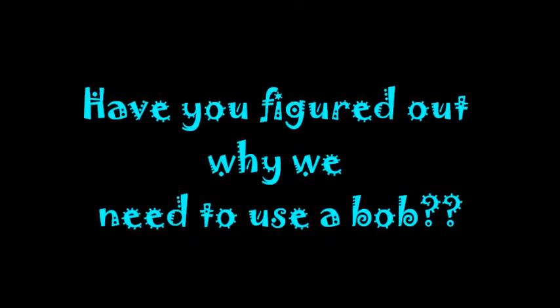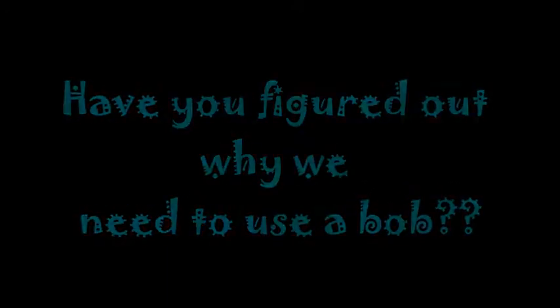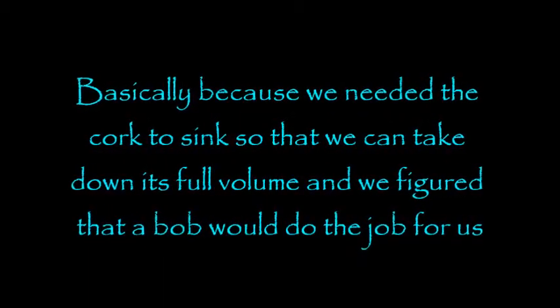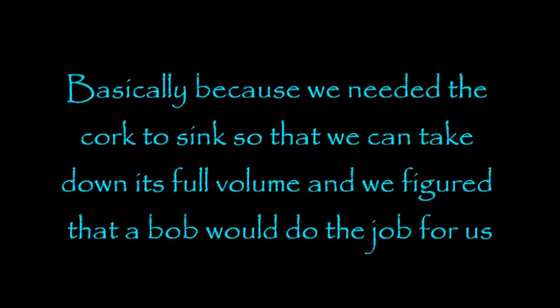Have you figured out why we need to use a bob? Because we needed the cork to sink so that we can take down its full volume, and we figured that a bob would do the job. Figure that out?